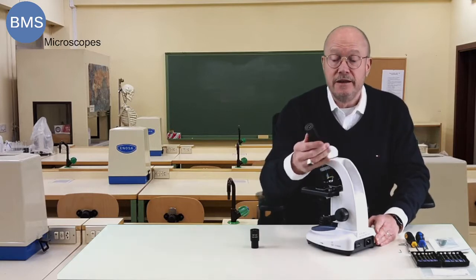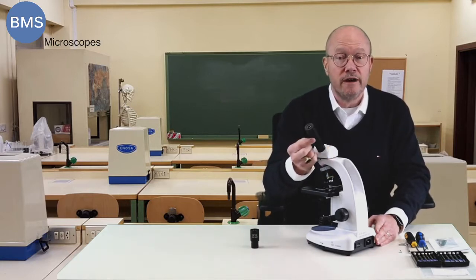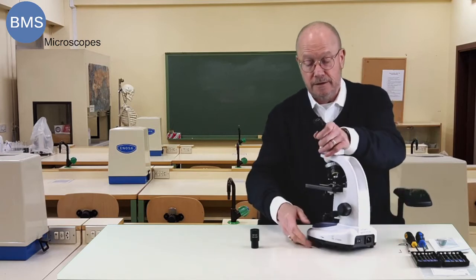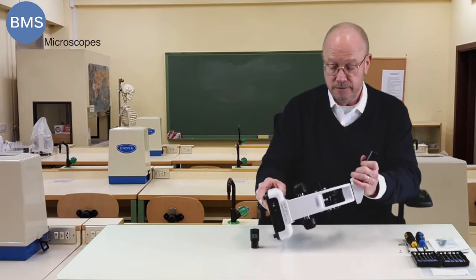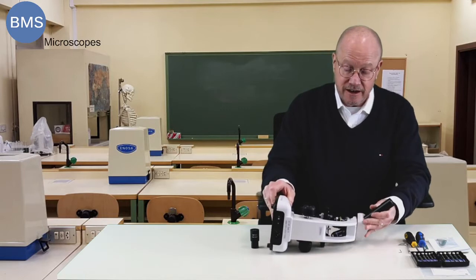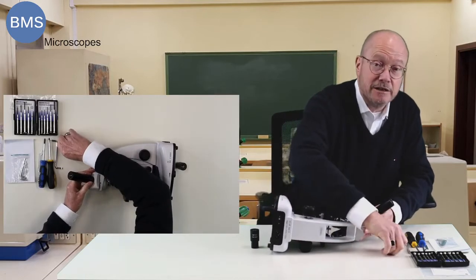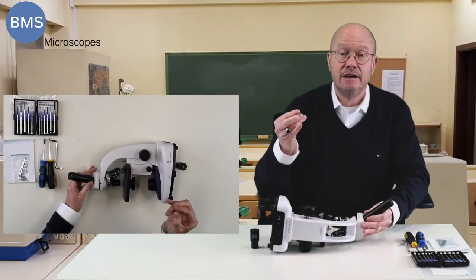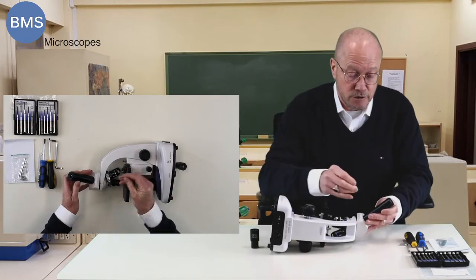It's quite simple. Underneath the tube you will find a little screw. Most of the time it's an Allen screw. It's a tiny screw. A 0.9 mm Allen key will undo the screw.